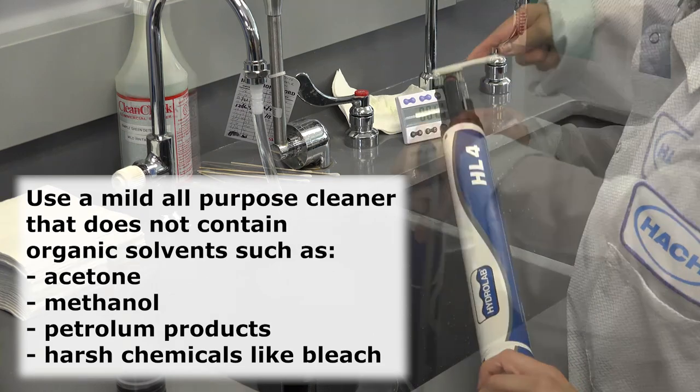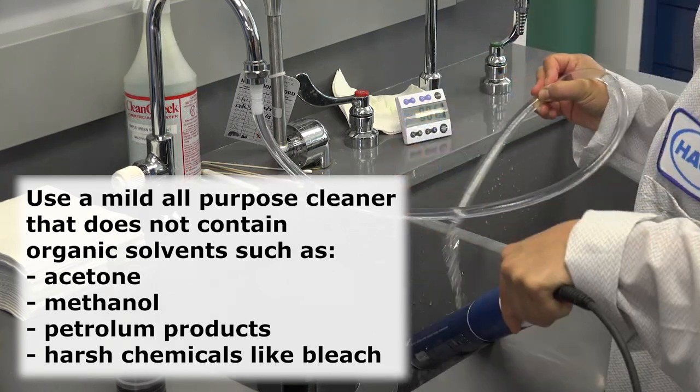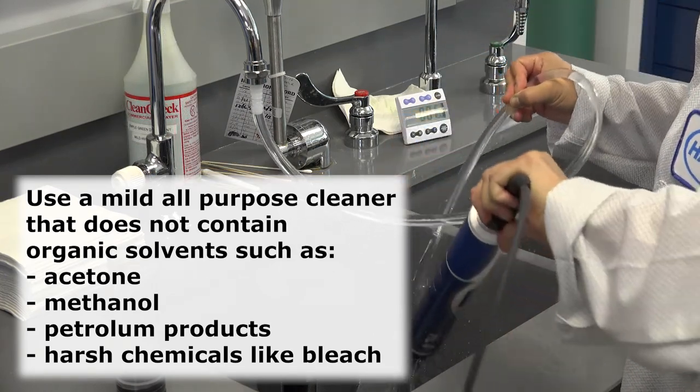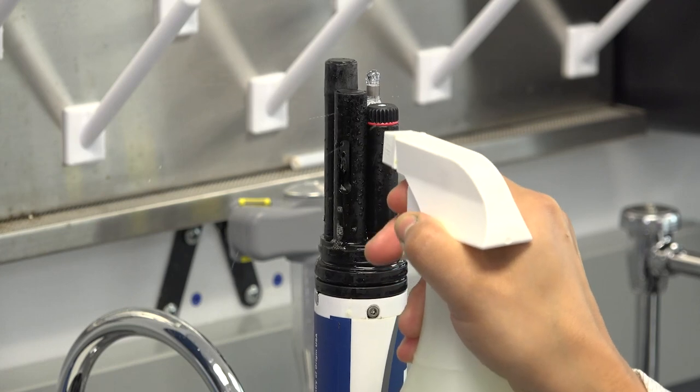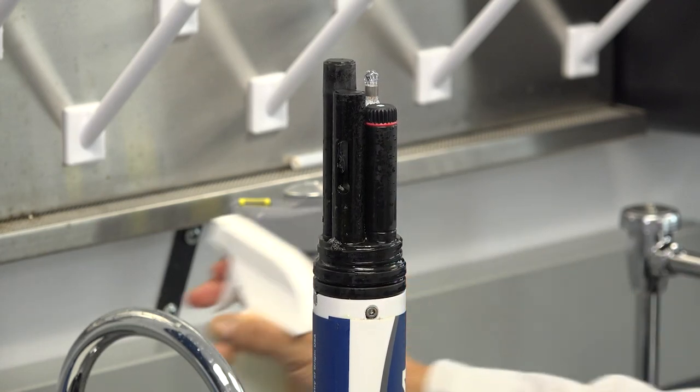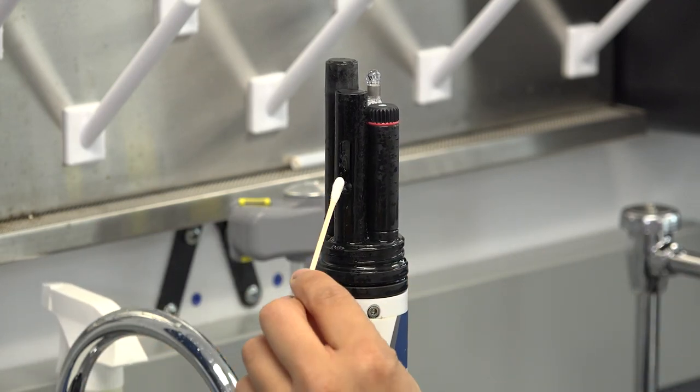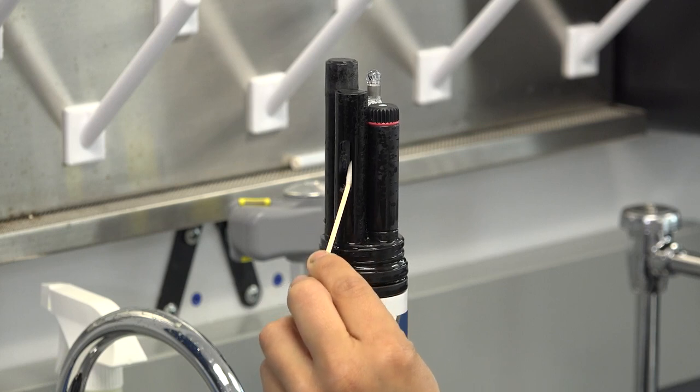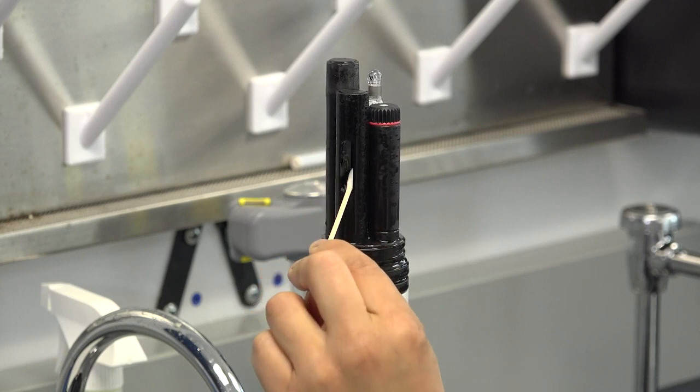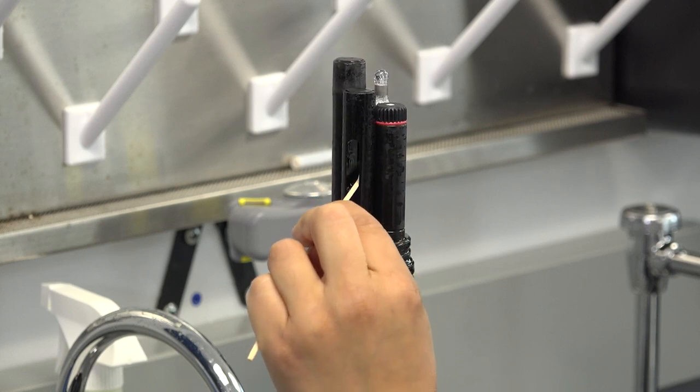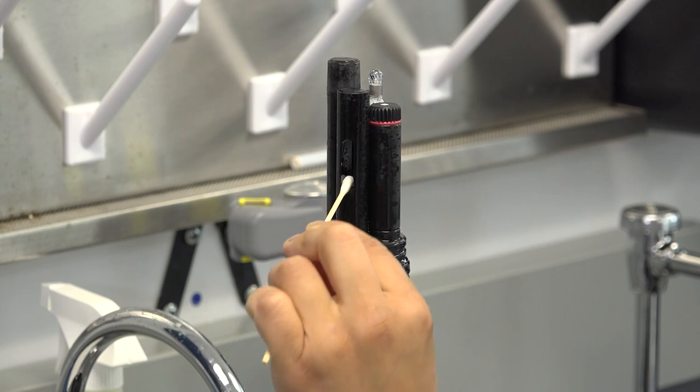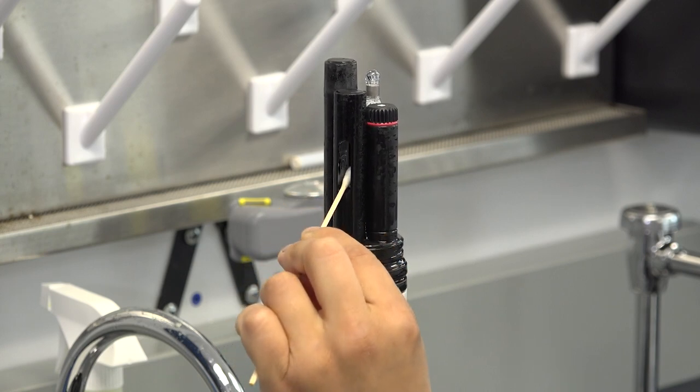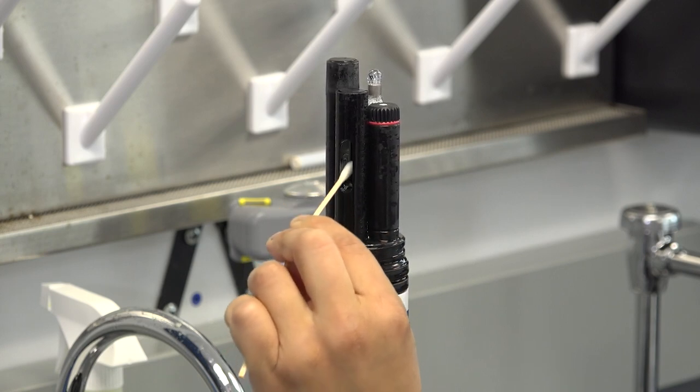Never use organic solvents such as acetone or methanol on any part of the sensor. The inside of the cell should be cleaned out after every deployment with a cotton swab or small brush. Additionally, prior to calibration of conductivity, all sensors should be cleaned. Any residue or debris on the sensors may contaminate the conductivity standards and change their value, resulting in an inaccurate calibration.